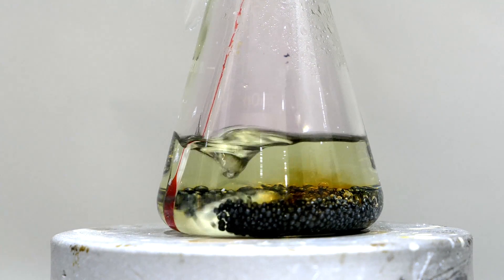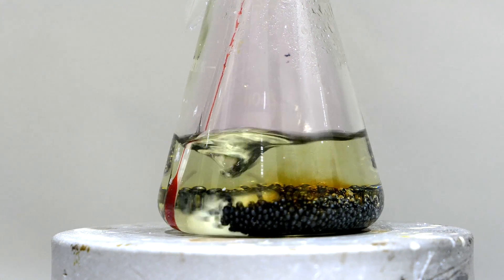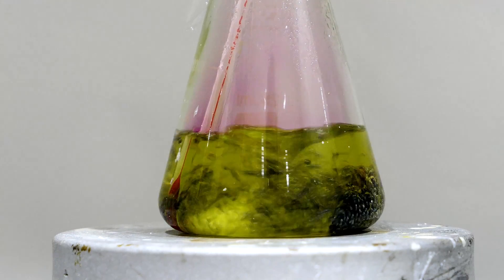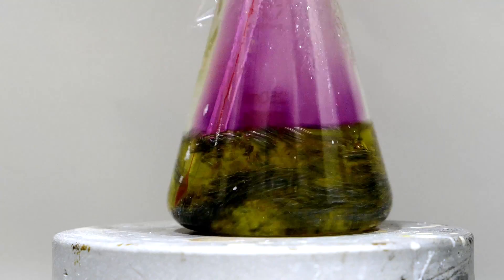As the reaction progresses, the solution will heat up. And if it rises above 90 degrees Celsius, submerge the flask into water to condense any crazy iodine vapor.